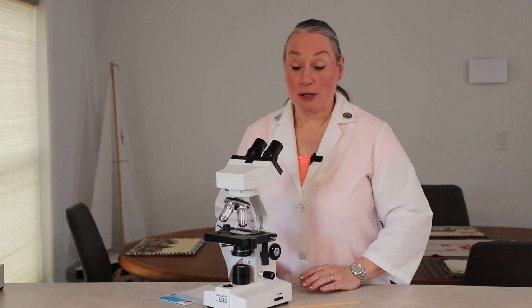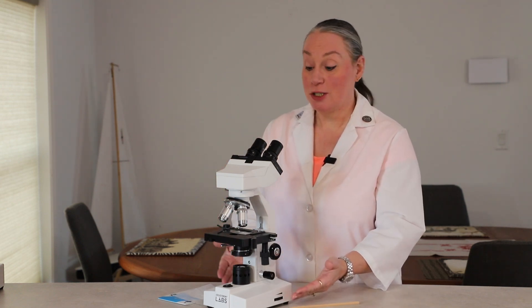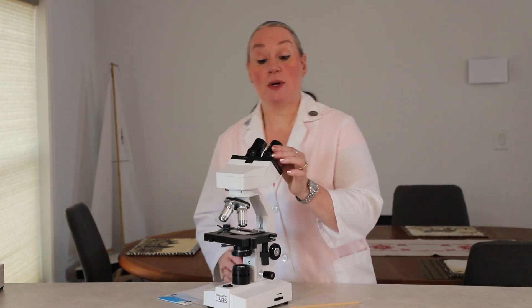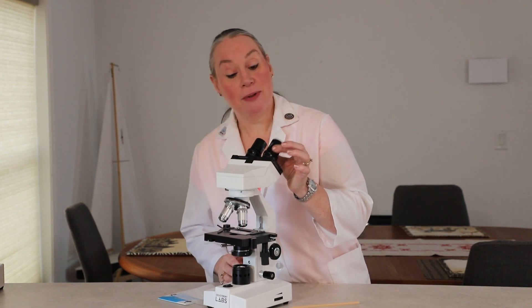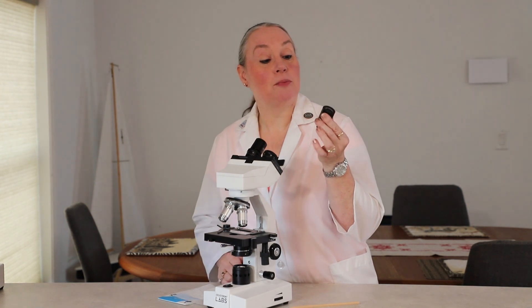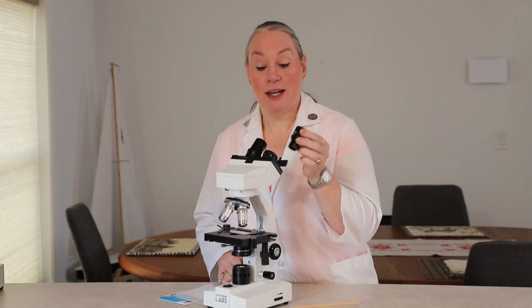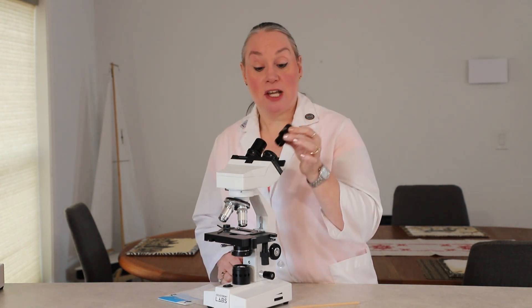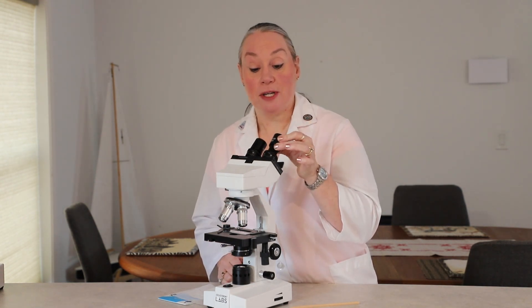We're going to talk about the anatomy of the microscope, and in doing that we are going to go from top to bottom. Starting with the very top: the eyepiece. This eyepiece on this microscope is magnified 10 times, and it is a removable eyepiece.